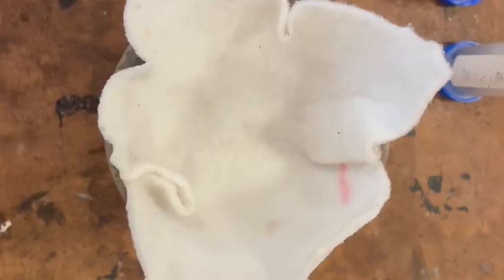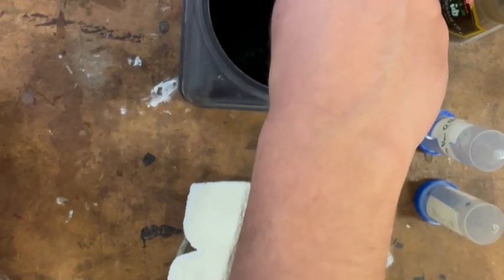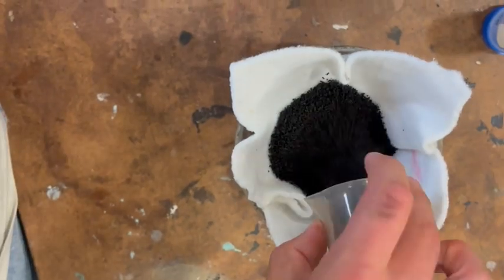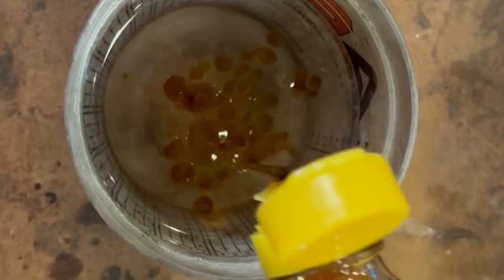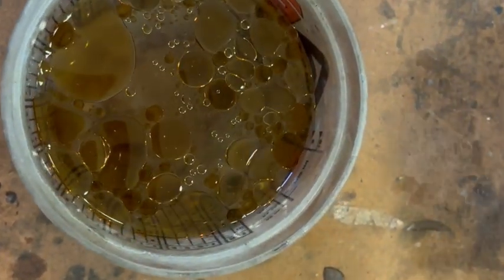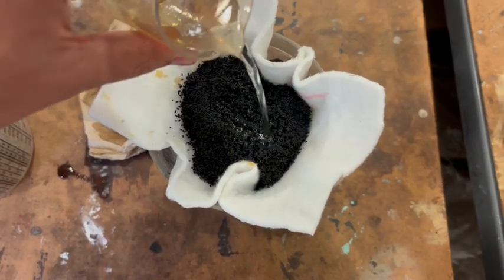So here I am constructing the system that the water will be run through. I'm using a micron sheet pretty much just to hold that GAC I'm putting in now. The water can flow through both the GAC and the micron sheet. For the sake of this demonstration, I'll be showing that GAC can help to remove oils such as sesame oil from water. So here is our influent, that's what we call the contaminated water, and I'm running the influent through this system.